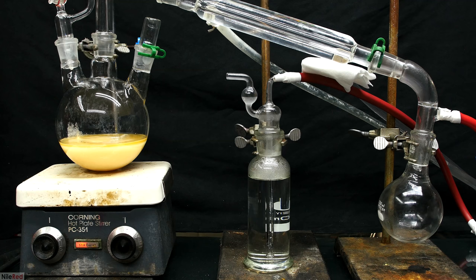So initially, in the cold hydrochloric acid, I had to keep the addition relatively slow, or else I'd lose trimethylamine hydrochloride out of the bubbler. However, as the solution heats up, I can slowly increase the rate that I bubble it through.